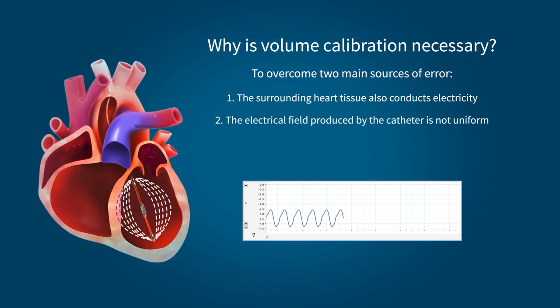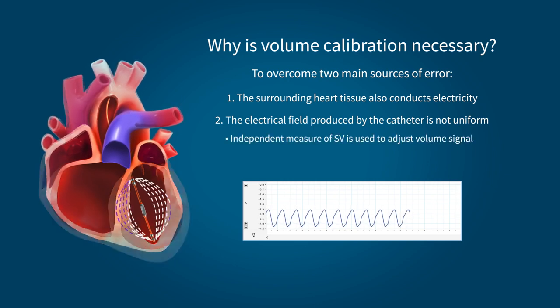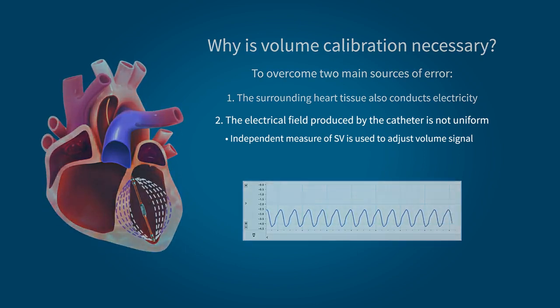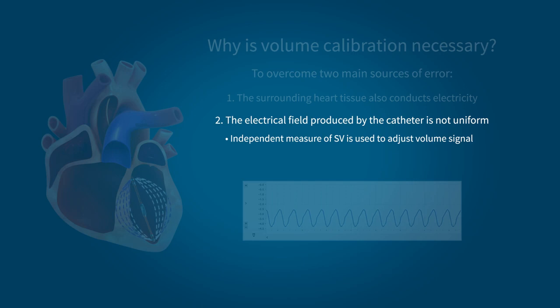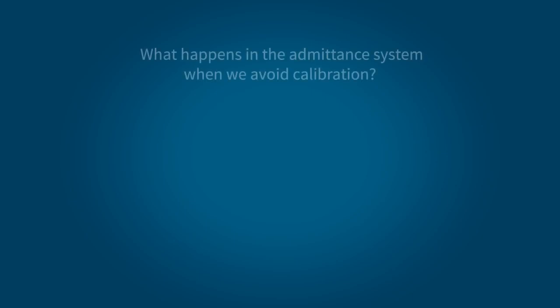And secondly, the electrical field produced by the catheter is not uniform. To account for this, a field correction factor, calculated from an independent measure of stroke volume, is used as a final adjustment to the volume signal. Let's look at how failing to do this final calibration step affects a commonly reported cardiac measure, stroke volume. We recorded PV data for both admittance and conductance systems from the same 5 healthy rats and analyzed the resulting data. First, let's look at what happens with the admittance system when estimated values are used instead of calibrating.